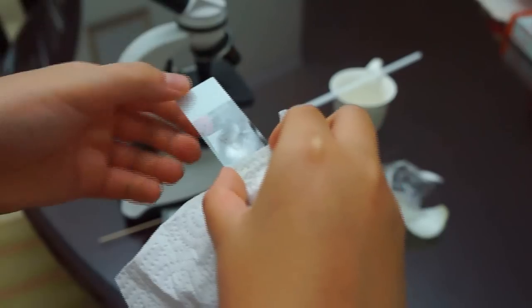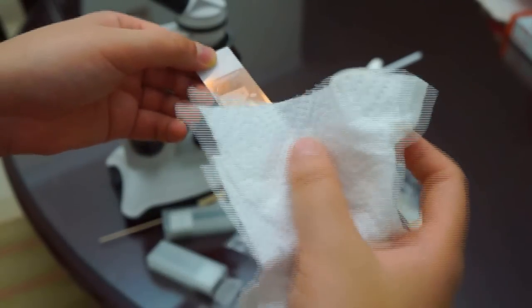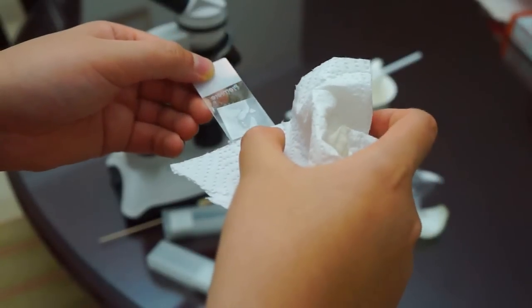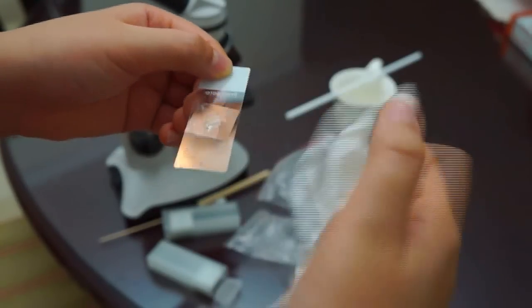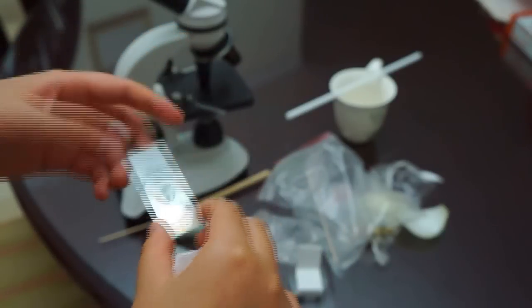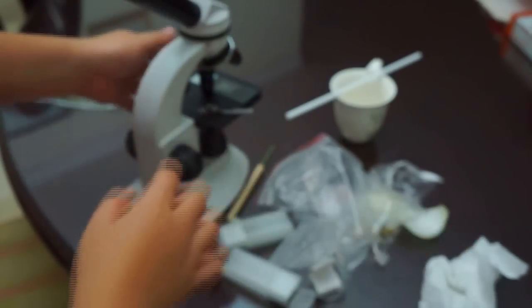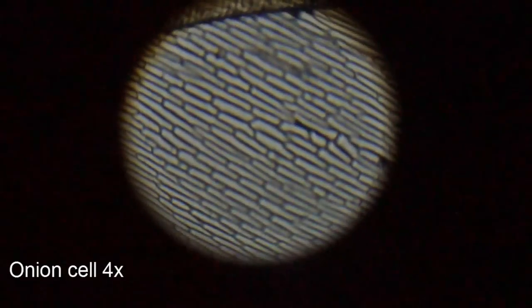Here we have our slide, and we're ready to put it in the microscope. Always remember that when putting it in the microscope, you should have the lowest power possible. I forgot it, but I changed it right away.